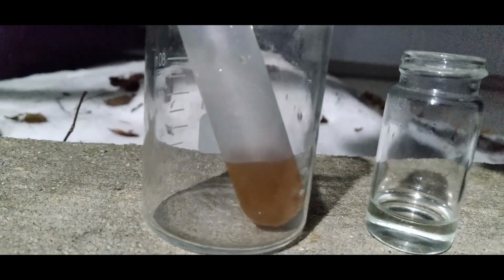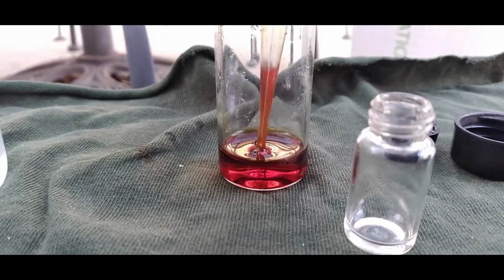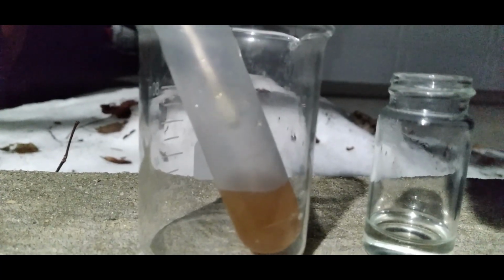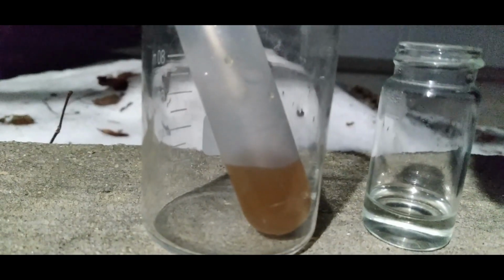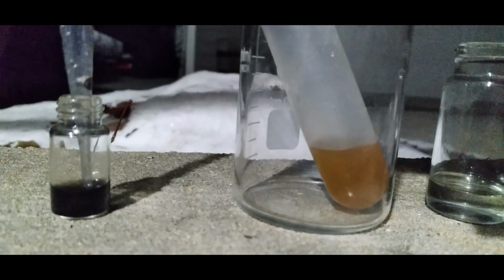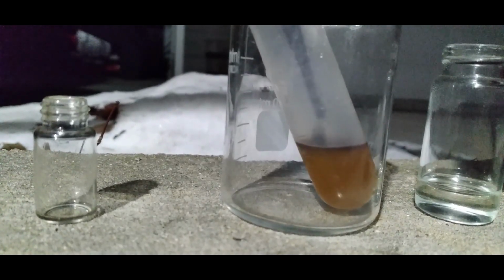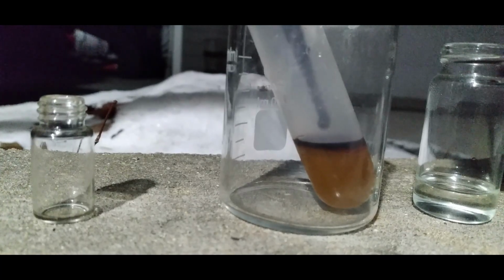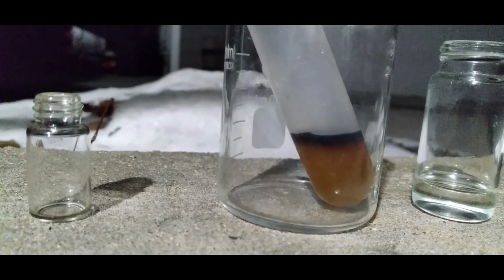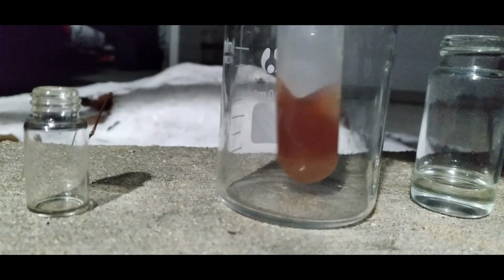Even after dissolving more of the dioxide, the solution kept somehow getting lighter in color. I've seen this happen before though with sodium osmate solutions. I'm not sure why it happens, but I decided to check to see if it was oxidizing anyway. No tetroxide is being given off apparently. I then decided to add more osmium dioxide to the solution. There we go, that's a nice red color.